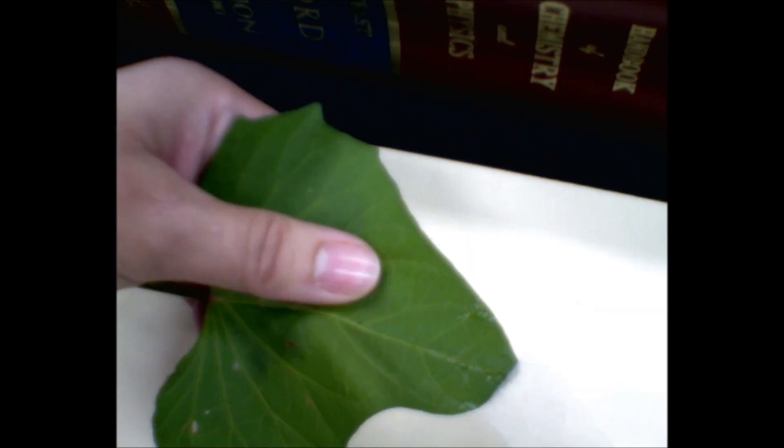And so you can see that the polish is coming off with it. And then that is what you stick down onto your slide.